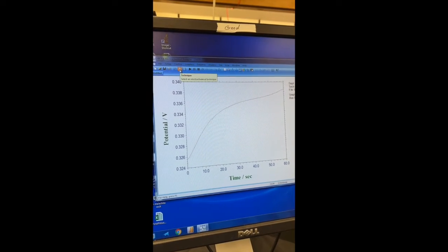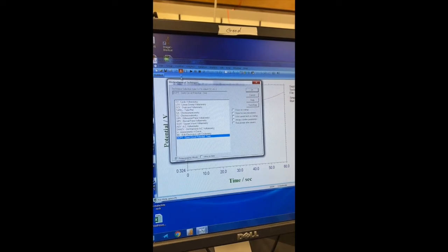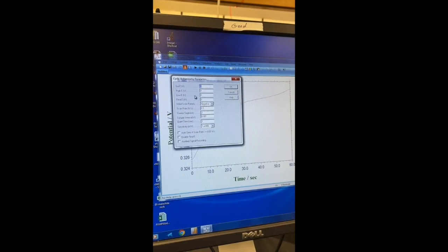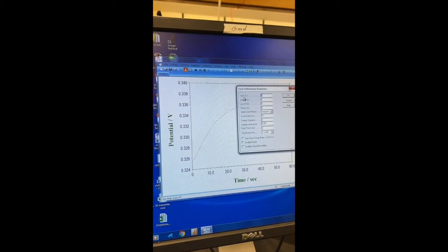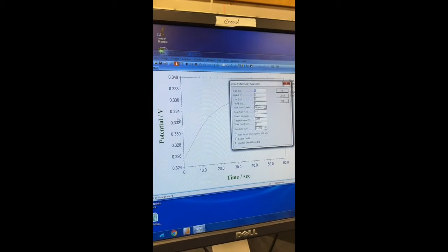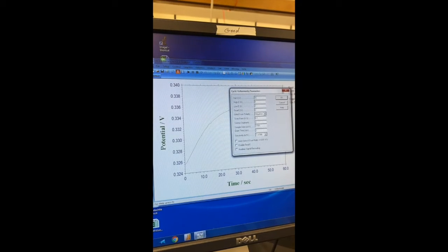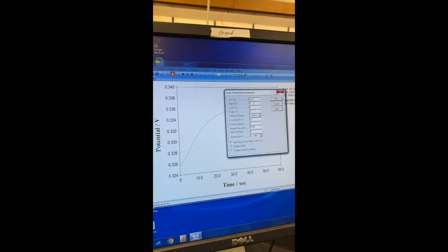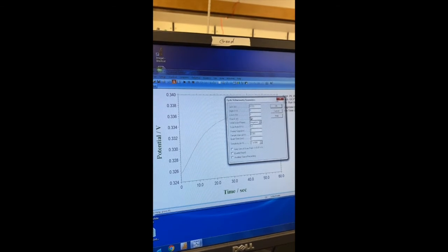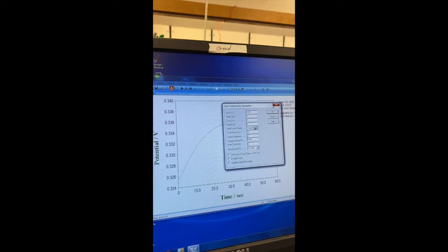And now we're going to run a CV. So we're going to come back here to the technique button, and we see CV at the top, cyclic voltammetry. I'm going to click on that. And so for this initial E value, we're going to use the voltage value that we got from our OCP. So in this case, I'm going to use 0.333. For the cleaning step, we're going to alternate between a high voltage of 1 and a low voltage of 0, so we can keep that as is. This is all good.